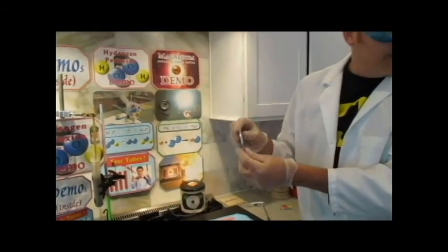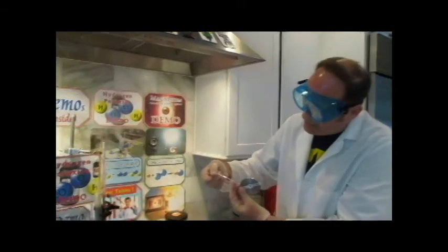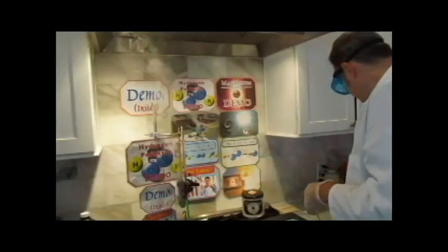Remember, metals are malleable. Metals are ductile. So you can make them into wires, and you can make them into sheets. Well, guess what? A ribbon is a little bit of both. It's almost as thin as a wire, and it's as flat as a sheet. So here's a little piece of magnesium metal. The problem is it's in the presence of oxygen, which is what it needs to react, but it's not reacting.